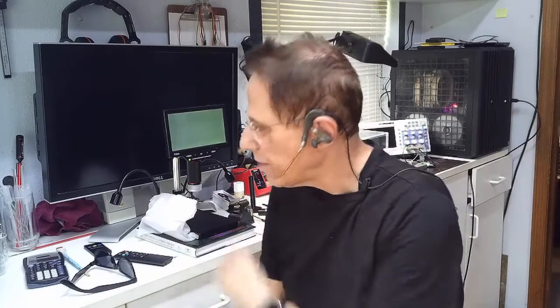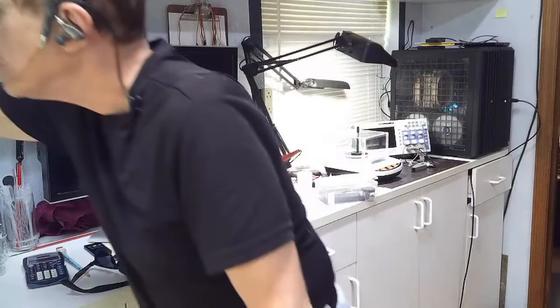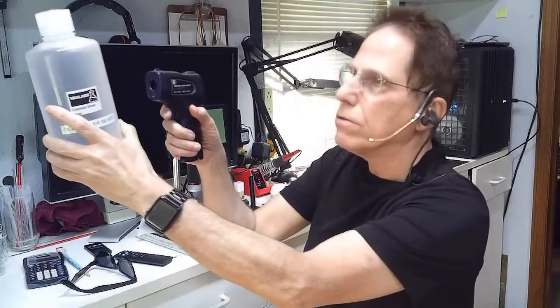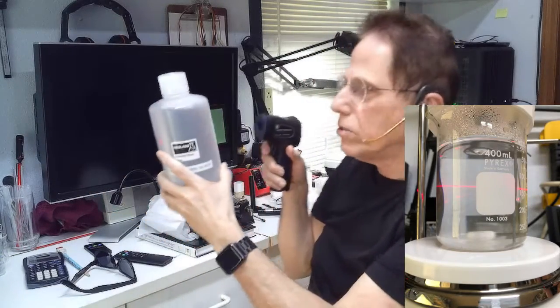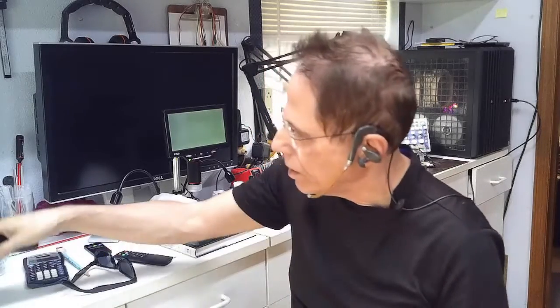I picked up the video microscope so that I could see what was going on in the colloidals. I wanted a way to measure parts per million, or at least see what was going on at an inner level. I remembered the laser trick — you take the laser and point it through the material and see the laser as it goes through. I thought if I had a microscope and pointed the laser through some liquid, the laser would light up the colloidals.